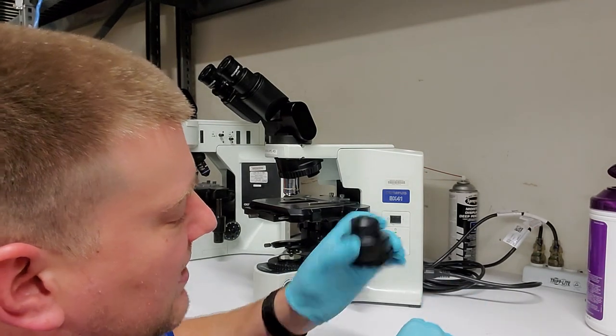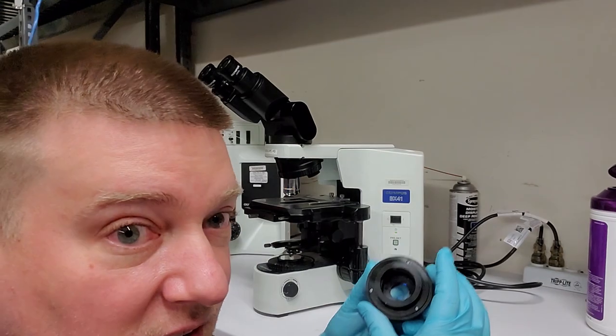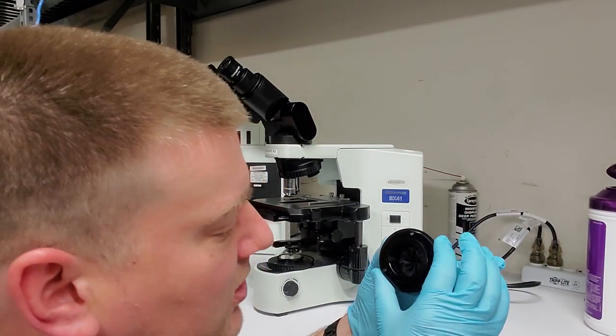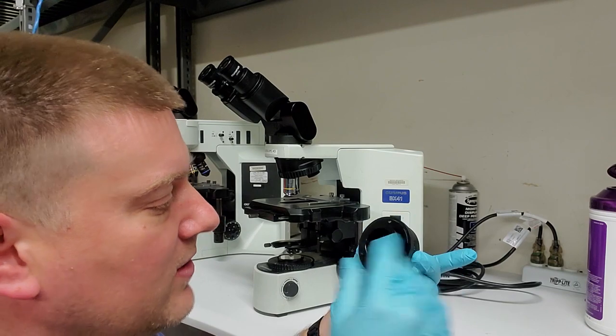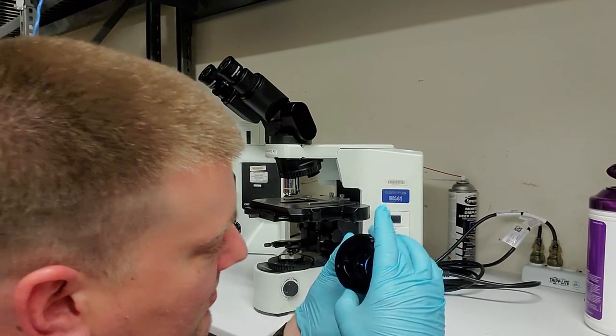So all the leaves are in an excellent condition of the iris. They slide nice and even. That's one of the things I'm looking for. You close it all the way down and you make sure that they're all nice and even. If one of the leaves is up, it's open too far, then this whole guy has to get sent off for a repair. This one is perfect.